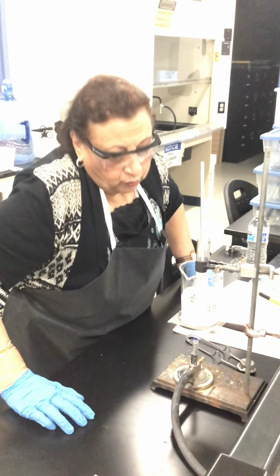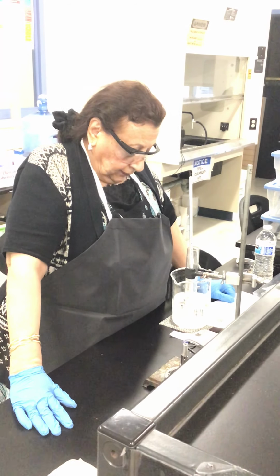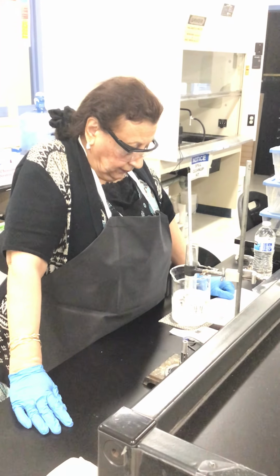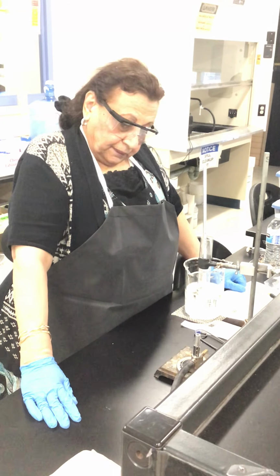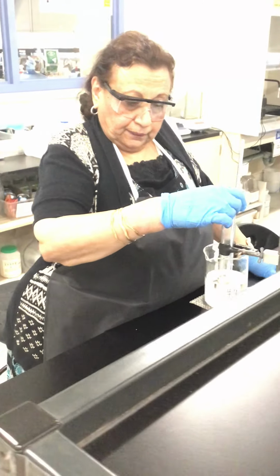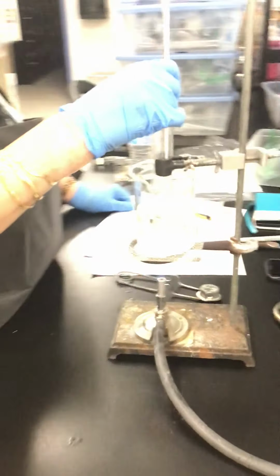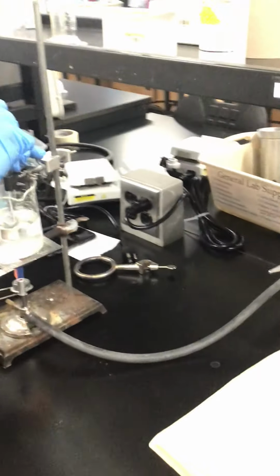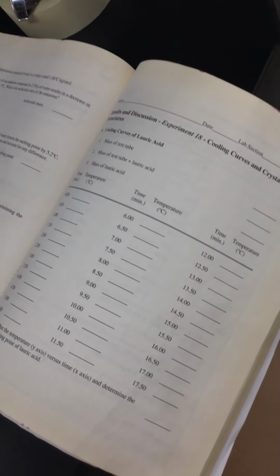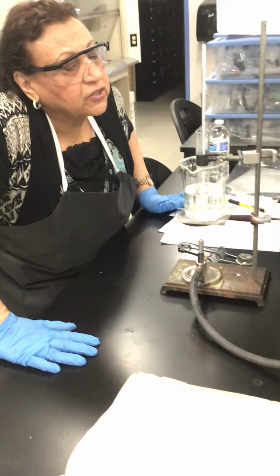Okay, it's almost 28. It's about 30 degrees here now.